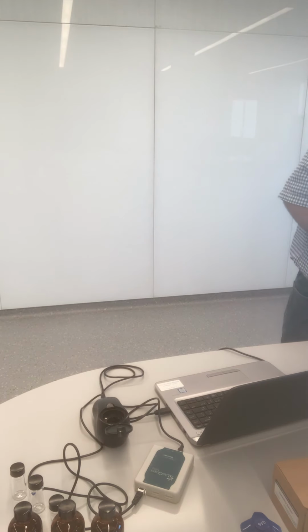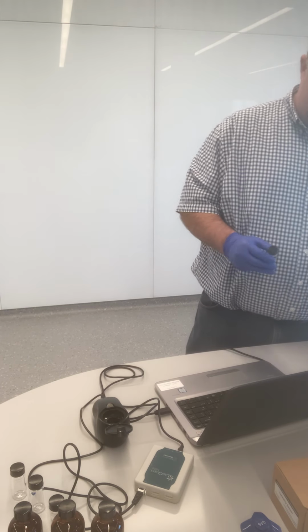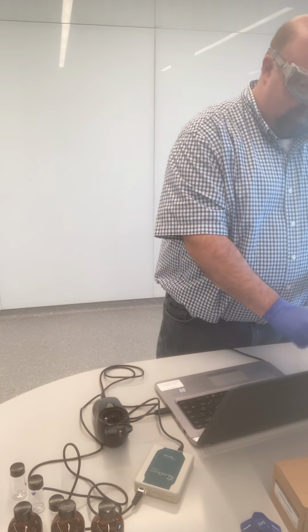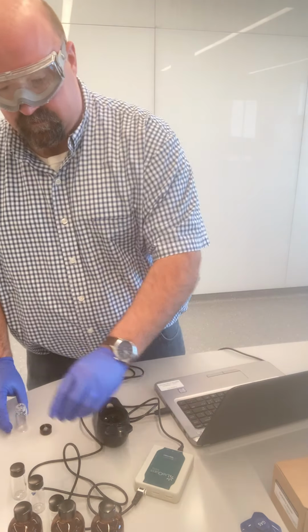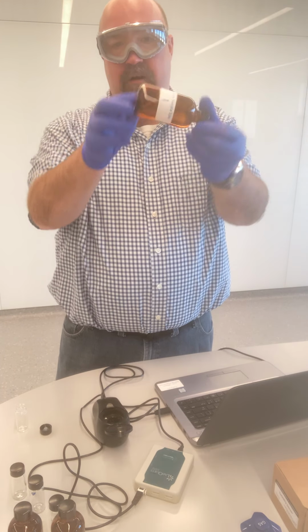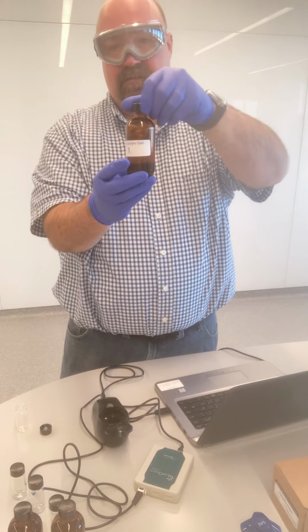And so now we're just going to start to get the readings for our Green River sample spots. I'm going to dump the water out of my cuvette. Sample spot 1. I'm just going to invert it a couple times, make sure it's nicely mixed in there.